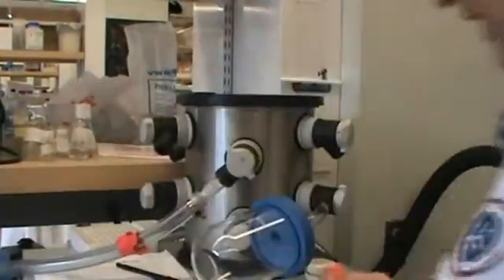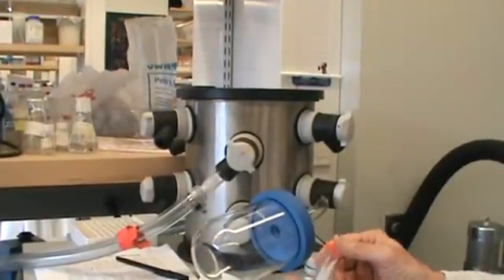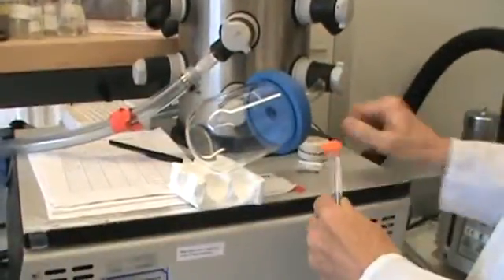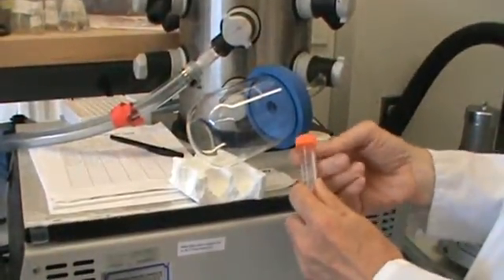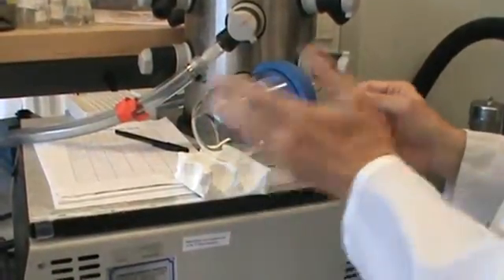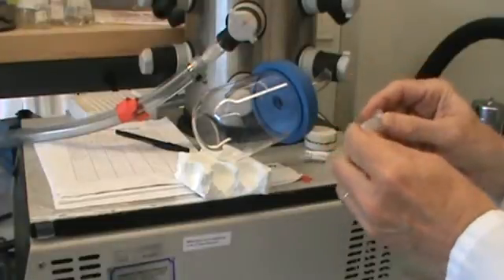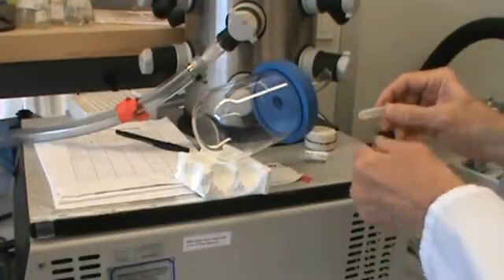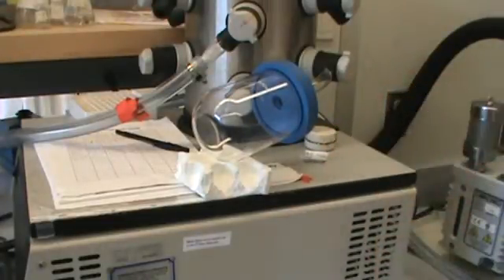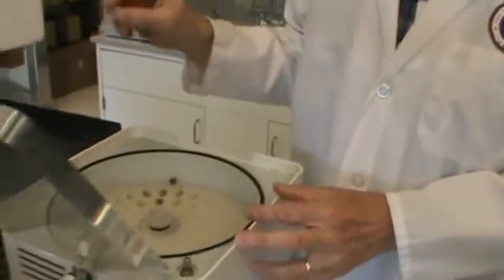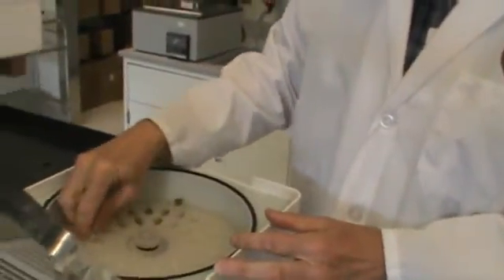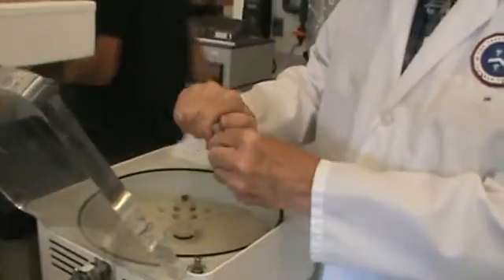Some people put test tubes in these with or without a filter to cover, a filter with holes in it in case pieces fly around. So the safe thing if you have a small volume is the SpeedVac. You would freeze it on the slant, then it would go in here. You see I only have one tube right there and a balance tube. This would go in open.